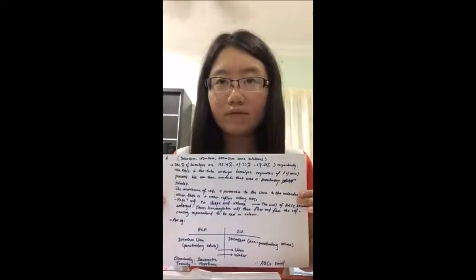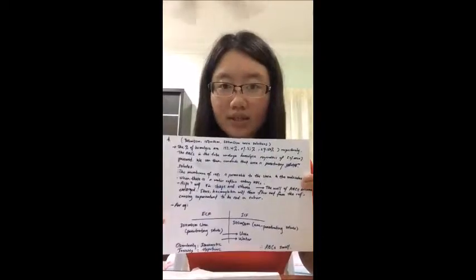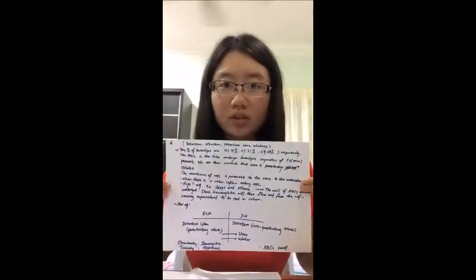Where there is a water influx entering the red blood cell, it will increase in shape and volume, and the wall of the red blood cell will become enlarged, and thus the hemoglobin will flow out from the cells, causing the supernatant to be red in color. So below is one of the examples of different concentrations of urea.